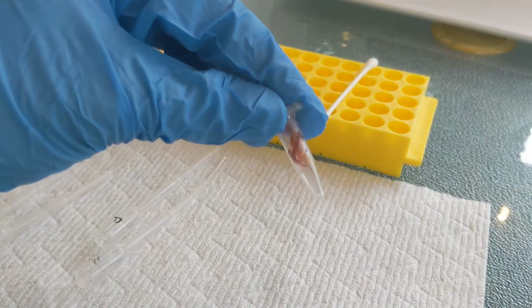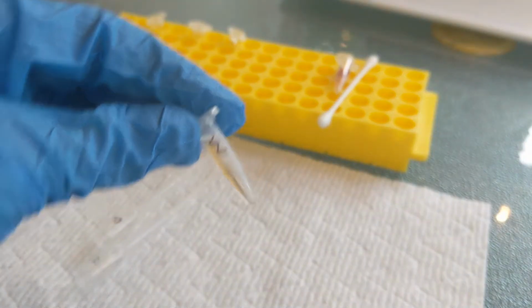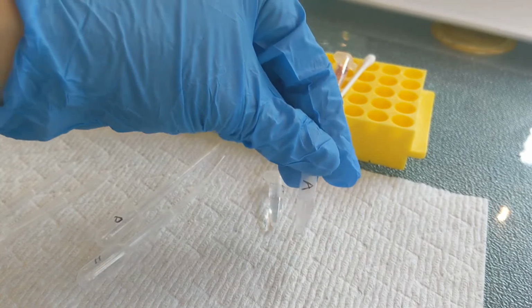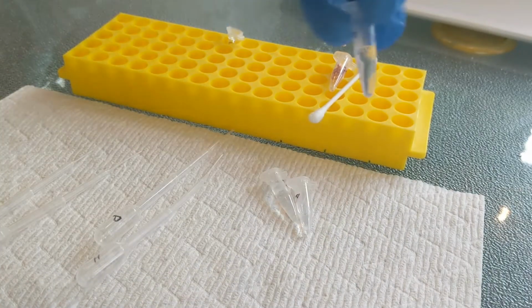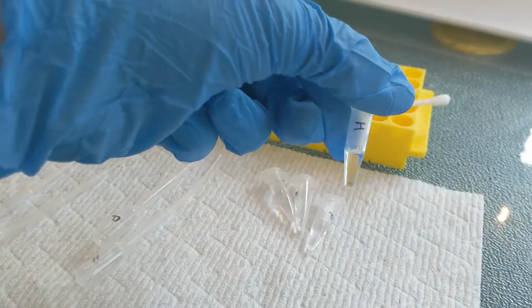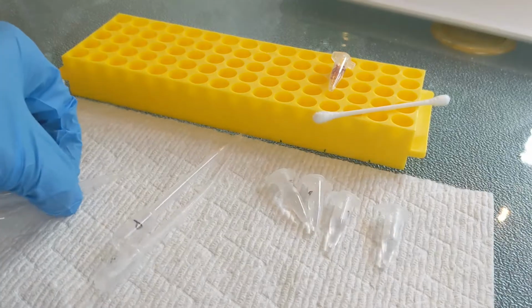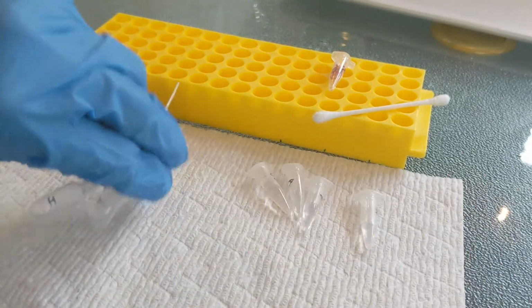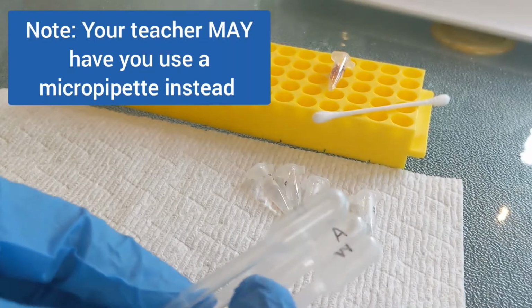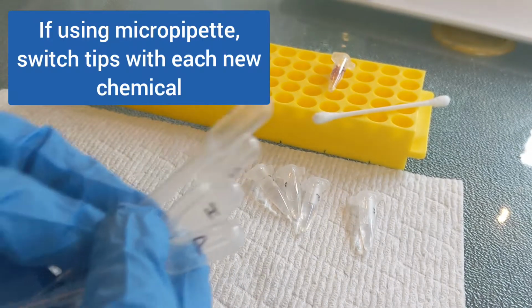So for this, you're going to need your swab to collect your sample, and you're also going to need your sample of what might be blood from the scene. You'll need water, and this should be distilled water ideally, and also alcohol, which can be ethanol or isopropyl alcohol. And you will need some phenolphthalein, and you'll also need hydrogen peroxide, and all of these should be in labeled tubes for you. And just to make sure we don't have any cross-contamination, I have labeled, and I recommend that you do this as well, some transfer pipettes with the same letters that you can see on the chemicals. So girls, when you do this, you should only use the A with the A chemical.